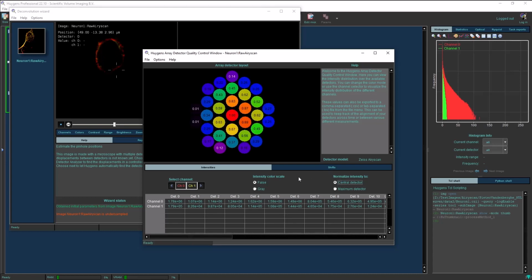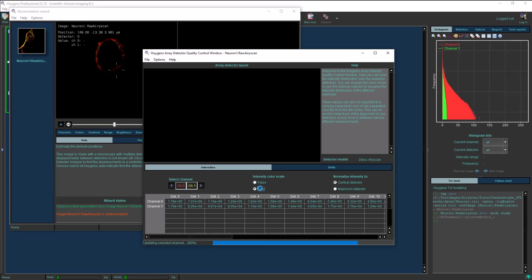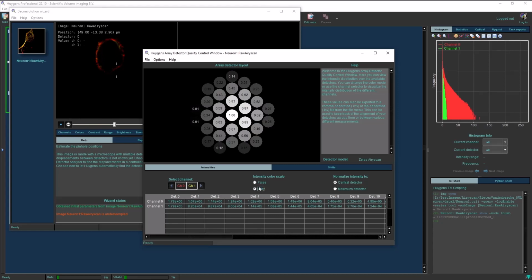Below the image, there is a table that lists the intensity per detector, where detector 0 is in the center and detectors 1 through 6 are the first ring, and so forth. You can choose to visualize these intensities in false color mode or in grayscale by selecting one of the radio buttons here. You can also choose to visualize the intensities of all the channels in the image, or selectively disable or enable the channels of your choosing.